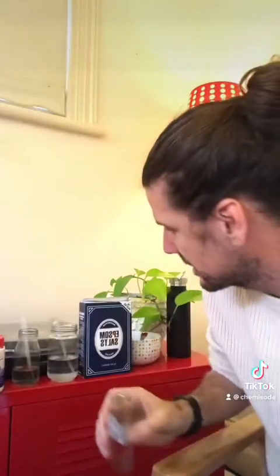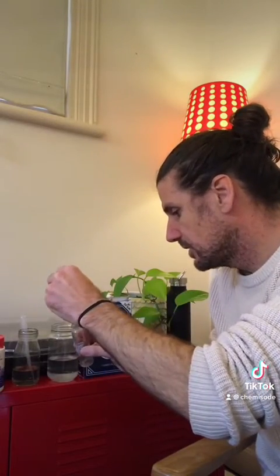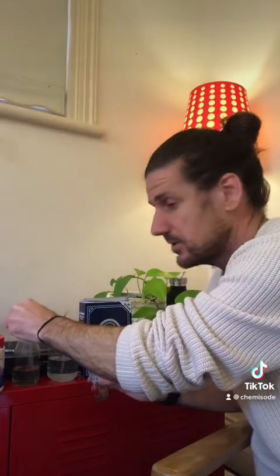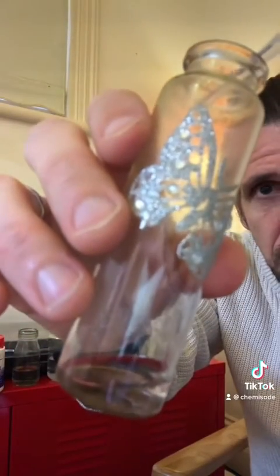Let's see what happens when we mix them together. In the butterfly test tube, let's get some magnesium sulfate — put a squirt of that in there — and then our sodium hydroxide. Take a little bit of that, let's go close to it, let's see what happens when we add a drop of sodium hydroxide.